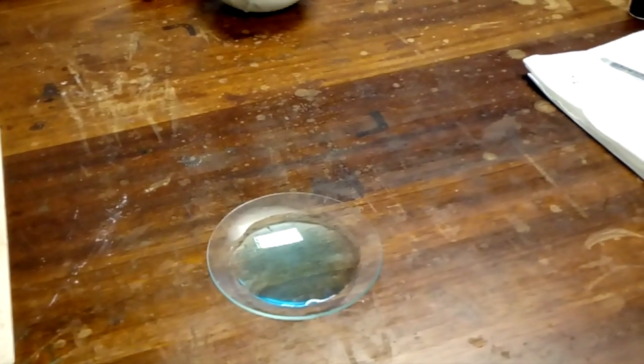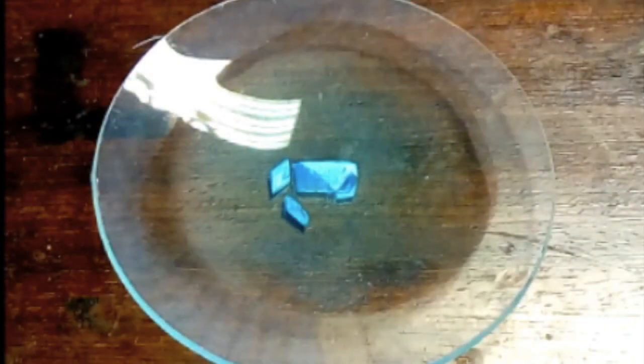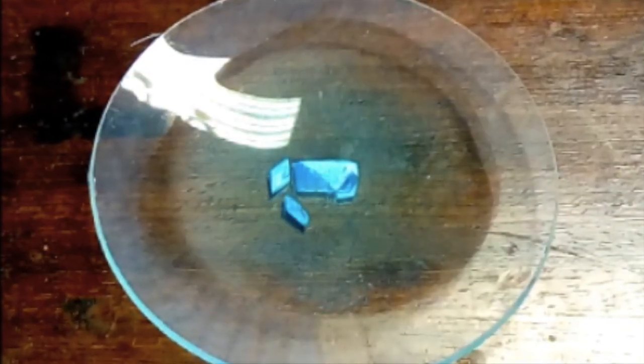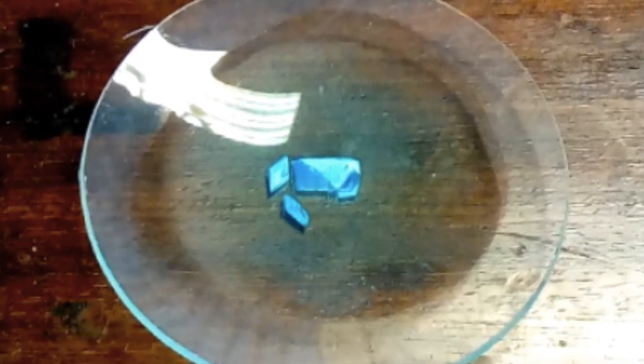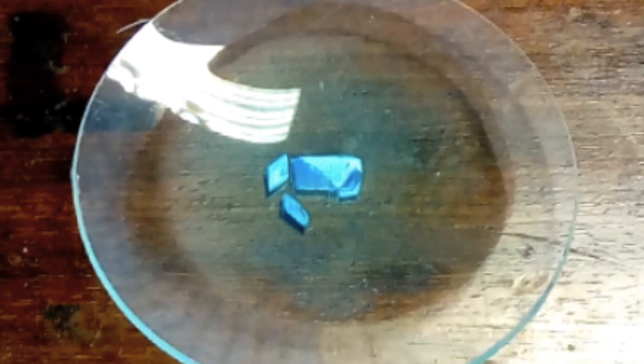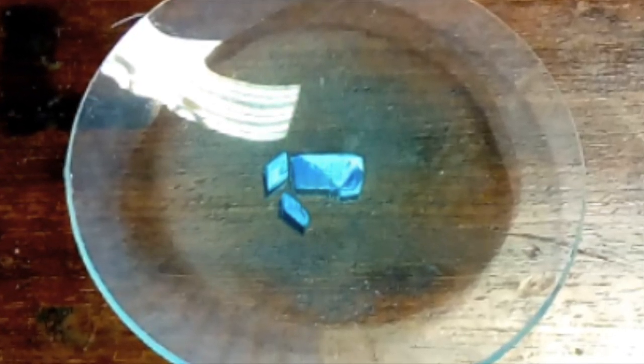Leave this in a cool place to allow crystallisation to occur. After 24 hours you should see that the blue copper sulphate crystals have formed. Remove these from the solution with a spatula and pat dry between filter paper to obtain your final product.